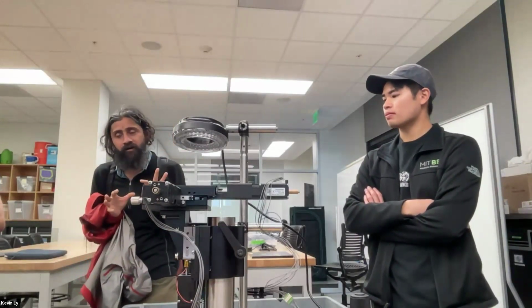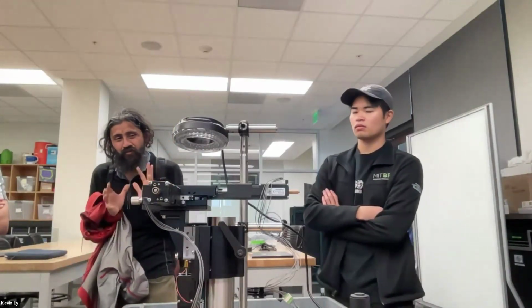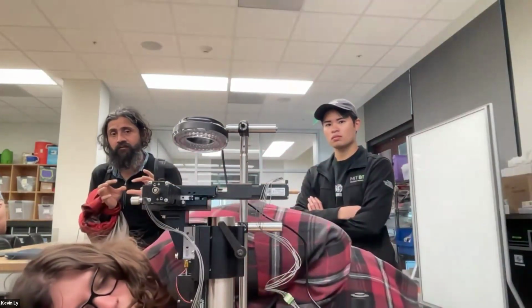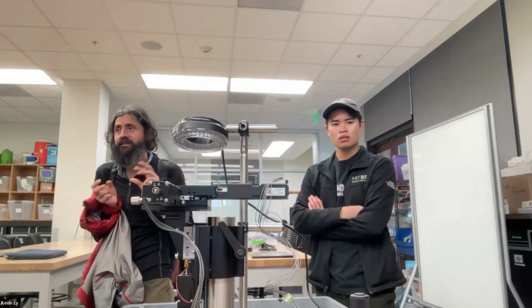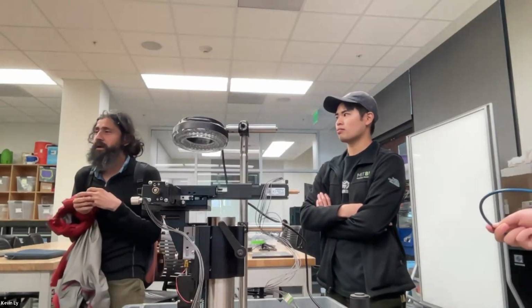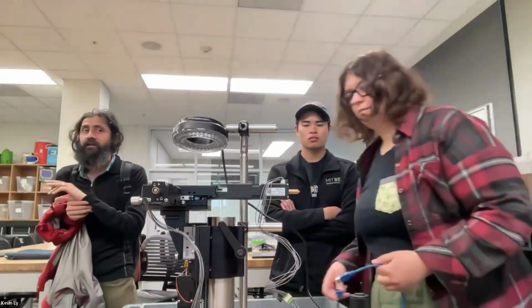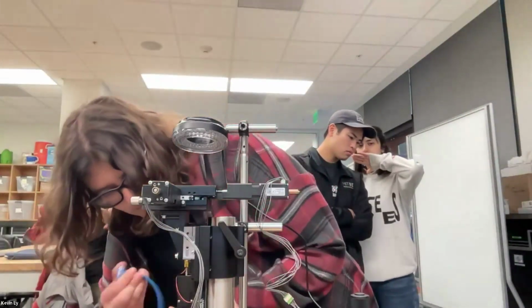In terms of cost in parts, that's important to discuss. Something like this costs us roughly between 3 or 4K for us to make. We are now starting to shrink that cost further, but it's important that we also keep the modularity. We keep these modularity primarily because then it's easy to reconfigure. When you turn something into a product, you can further reduce the cost, but it loses some amount of reconfigurability. So when we productize them, we make them very differently. This is really just plug and play that you should feel that, oh, I can hack this microscope.